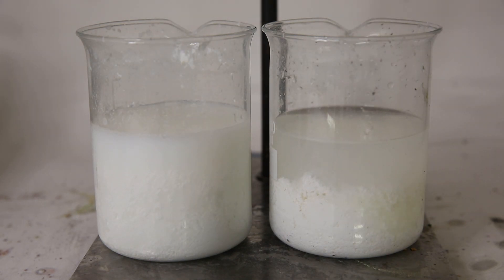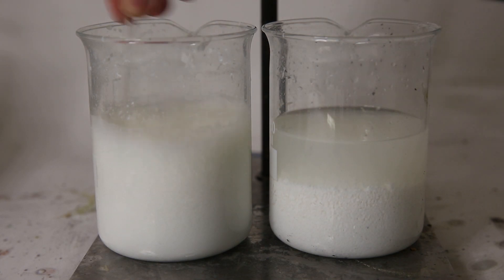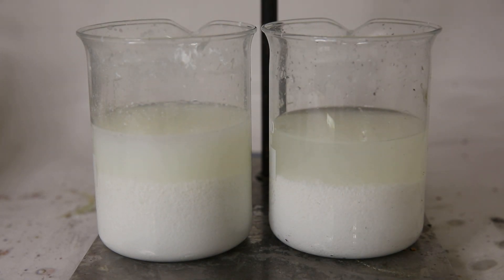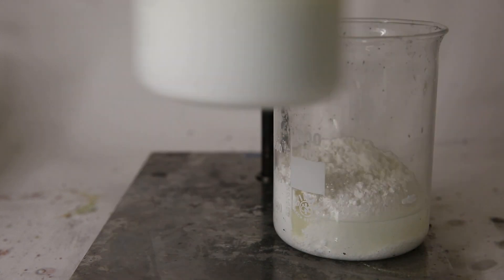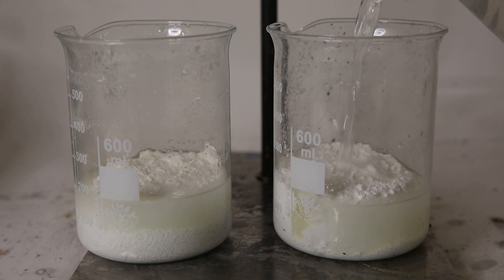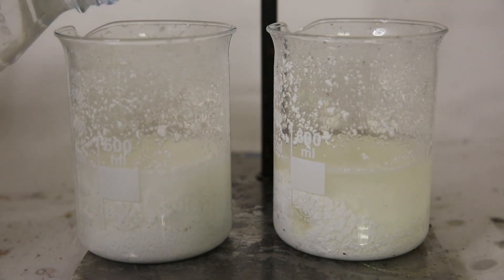So before using the silver chloride, we need to purify it a bit, since there are still nitric acid, gluconic acid and other impurities remaining. To do this, I washed the silver chloride several times with a saturated sodium bicarbonate solution and water. Sodium bicarbonate will destroy any remaining nitric acid by forming sodium nitrate, water and CO2 gas, which we can see bubbling out of the solution.